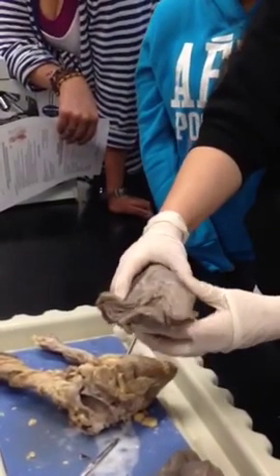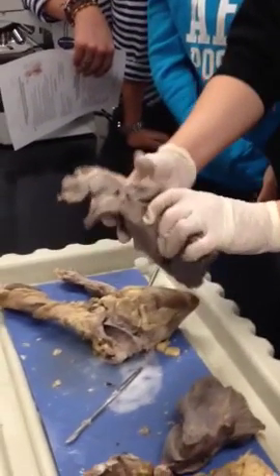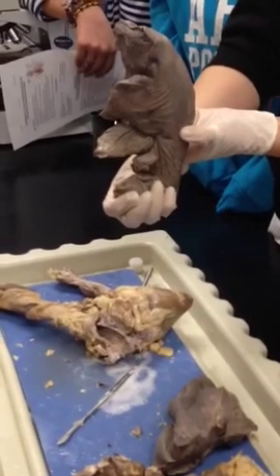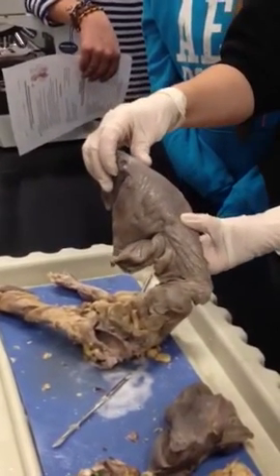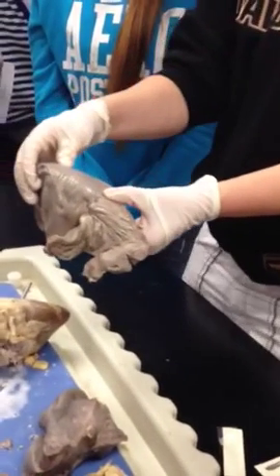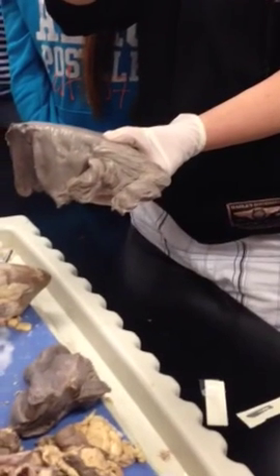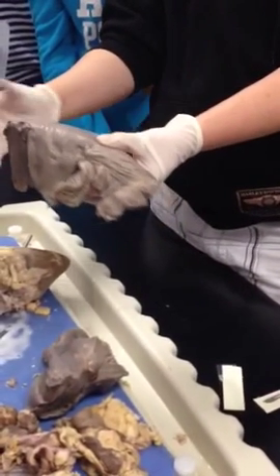How is it opposite again for the human? It's just the other way. So this would be inferior, this would be middle, that would be superior. The superior is larger in a human. If you look at the model, see how the most superior lobe at the top is much larger? And if you look at the inferior, it's much smaller. It's opposite in a human.